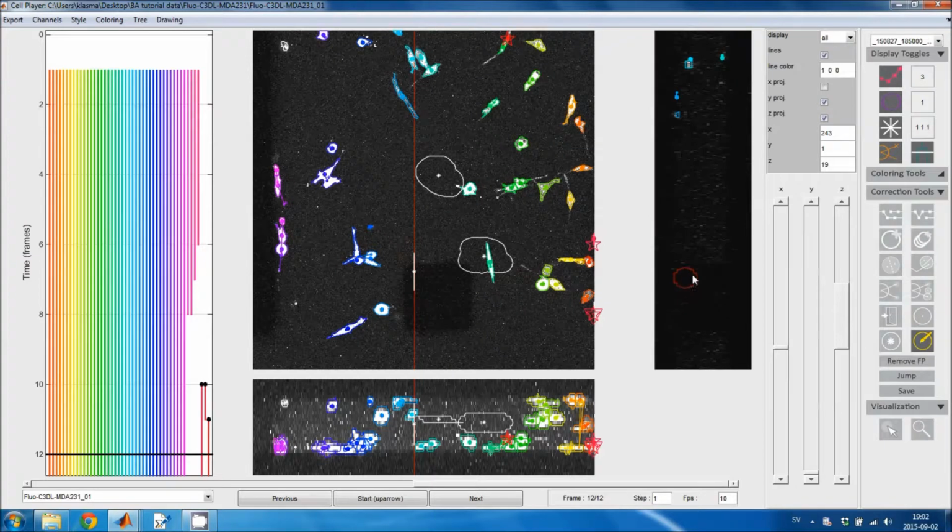And I can do the editing just in the same way and build a volume through the X slices instead of the Z slices. So this is everything I'm going to show in the 3D view.